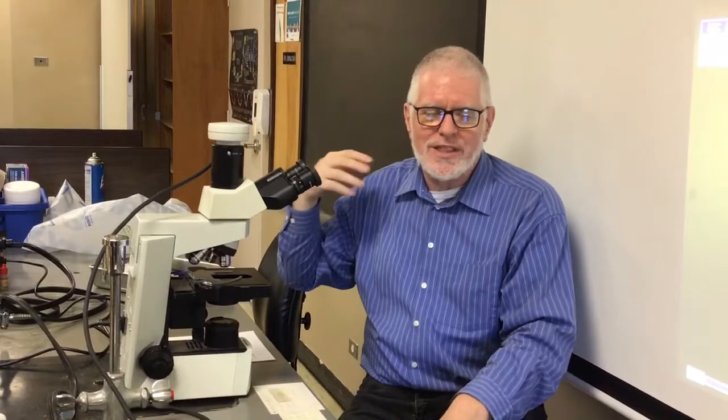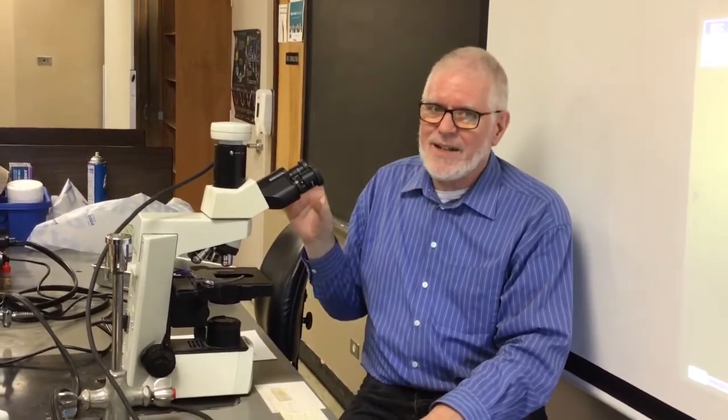But this is a video microscope, and so it can project a picture so that you can see what I'm seeing. It's a little different from the microscopes we use in our actual lab. The controls are all the same, but it's set up just a trifle different. So if you do wind up working with a microscope, it's good to know that the basic controls are always the same, but sometimes you'll go, well, how do I move the slide? How do I open the iris diaphragm? That may vary from scope to scope.